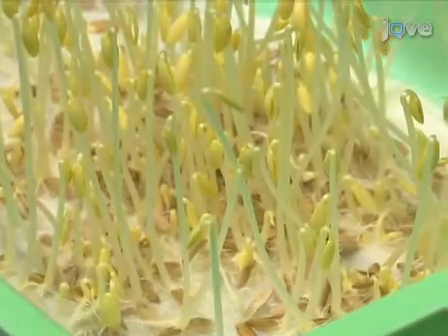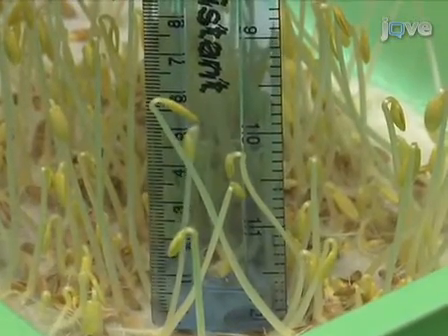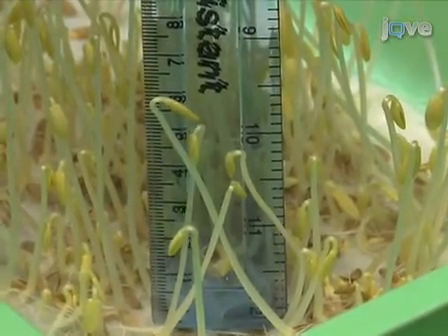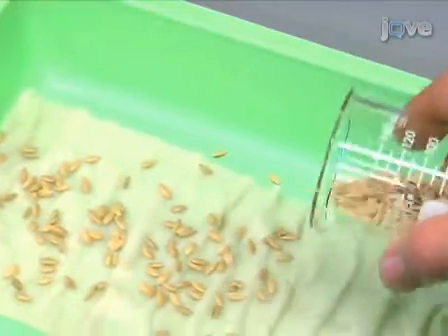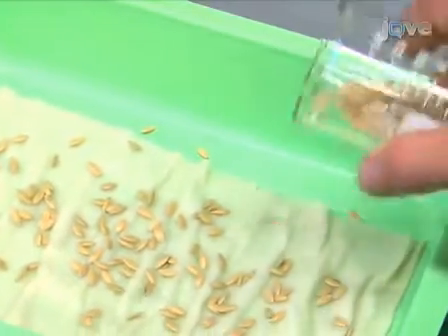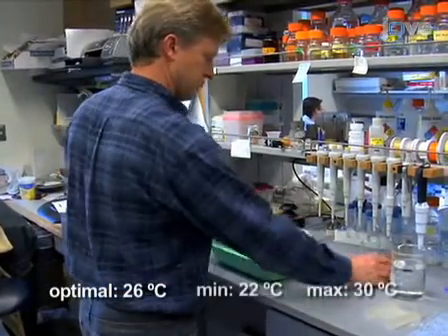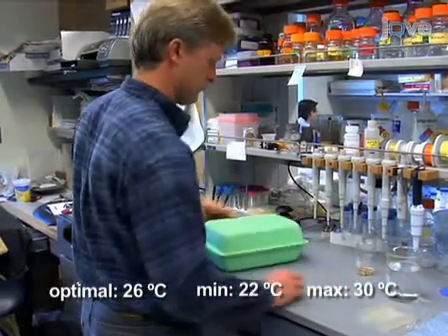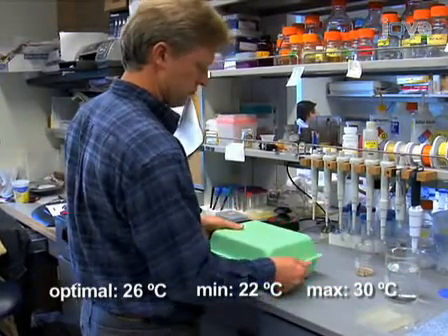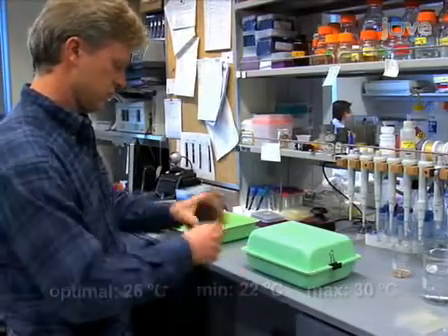In our experience, young hypocotyls from etiolated cucumber seedlings serve as a convenient source of cell wall material for these experiments. Cucumber seeds are sown on wet paper in a light-proof box, which is kept in a darkened cabinet in a constant temperature room set at 26 degrees Celsius. Temperatures between 22 and 30 degrees Celsius will also work, but it is important to note that the temperature will determine the rate of growth. The warmer the temperature, the faster the seedlings will develop.